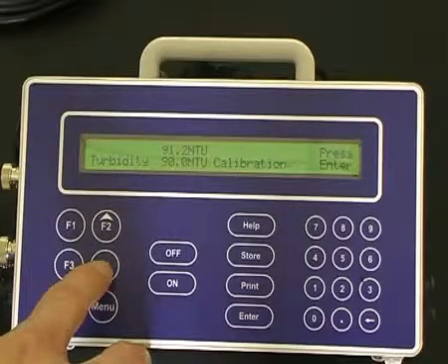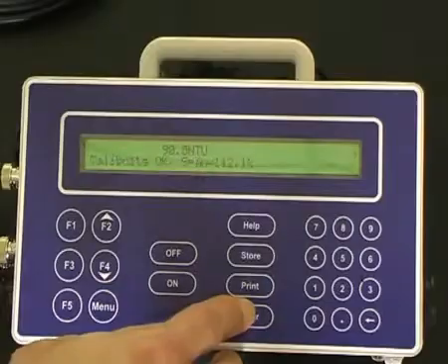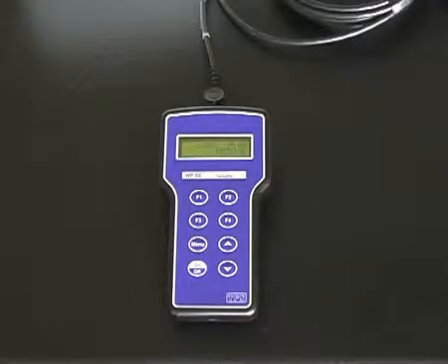To calibrate a TPS WP 88 turbidity meter, the procedure is the same as for the TPS 90 FLT.